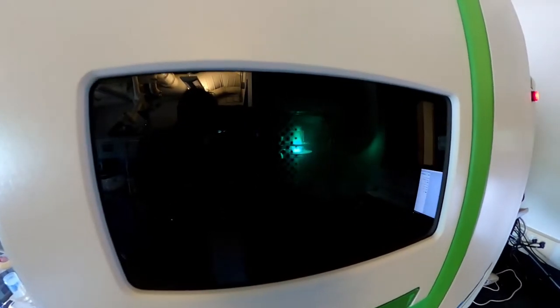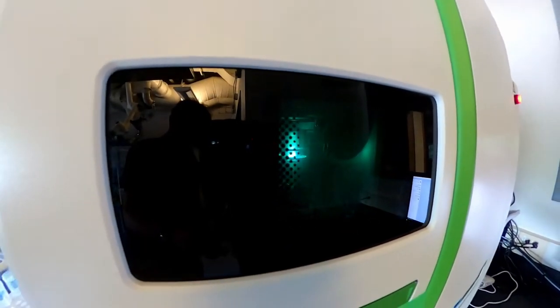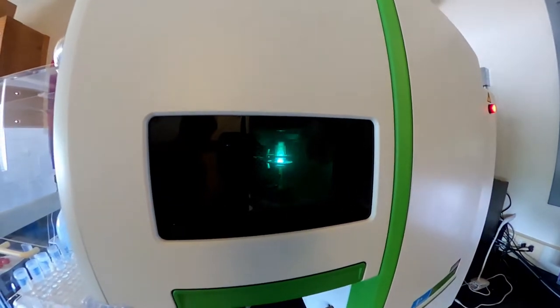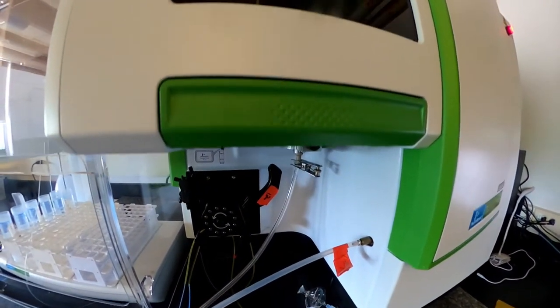We have one sample from a water fountain in our geology building here. And those fountains have not been run for the better part of four months. We've tested them before, and they've been clean. But we're curious what happens when the water sits in the pipes for four months. And there's our plasma. And your samples are going to be injected into that plasma. You can hear it. You can see it. And that'll give us our analyses.